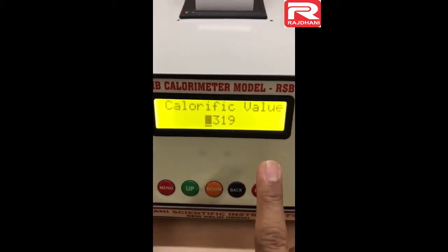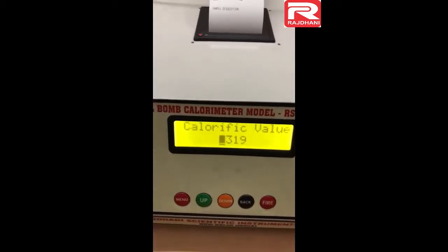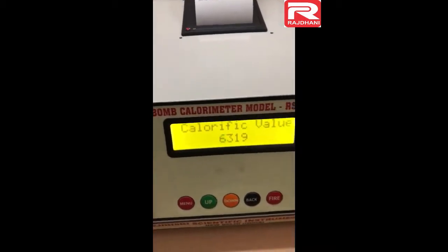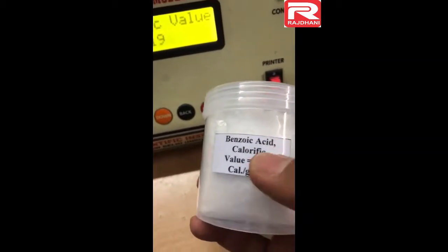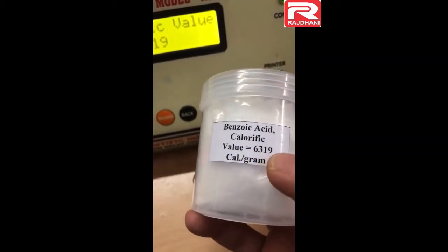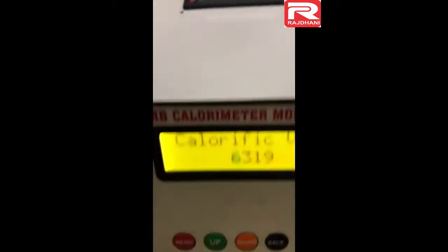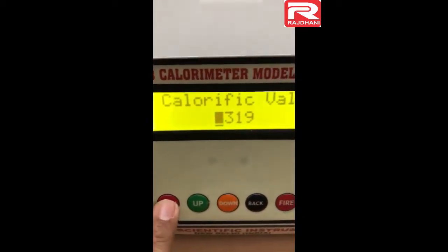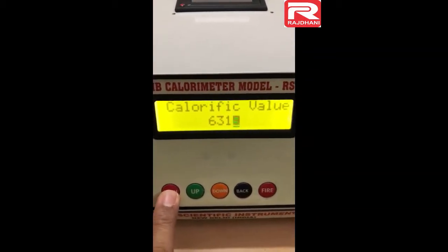It is asking for the calorific value of benzoic acid. On every benzoic acid box, the calorific value is pasted — it is 6319. So we have to feed this value, not the value just given by the machine. We will feed 6319. Since it is already there, I'll move further and press the menu button.